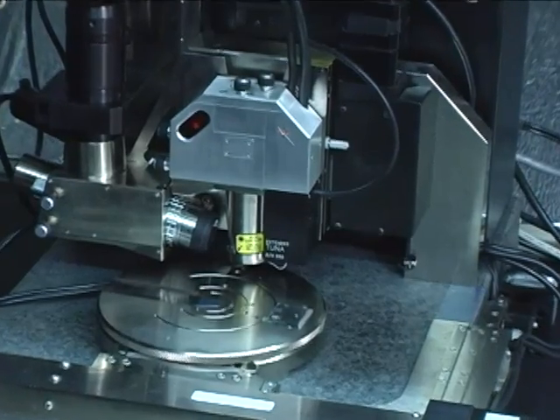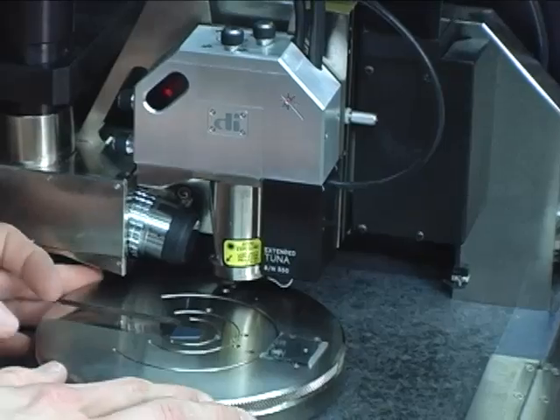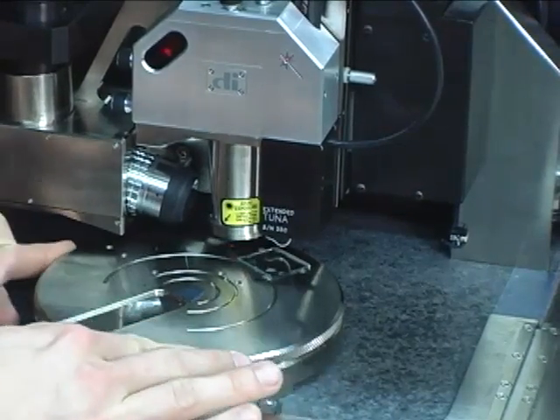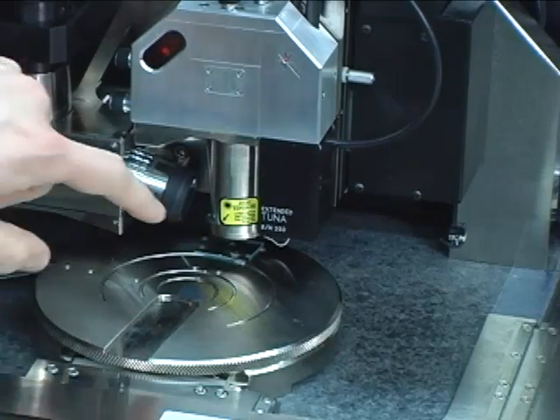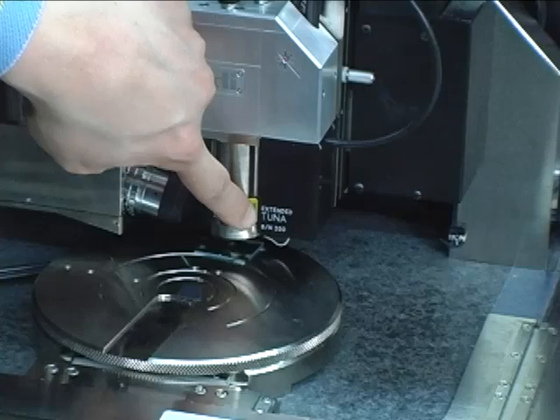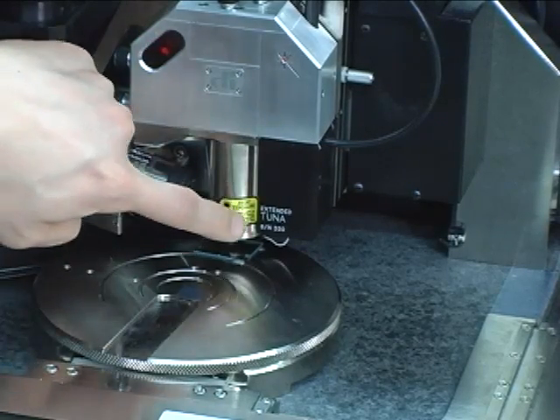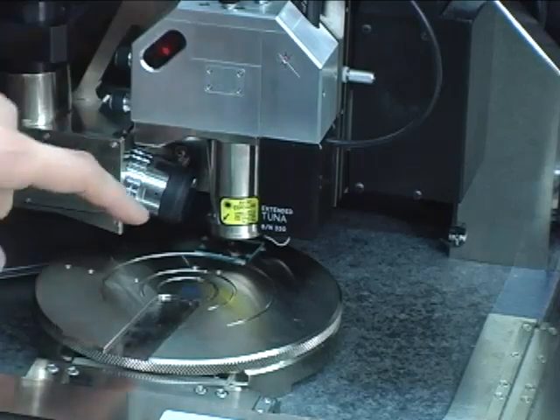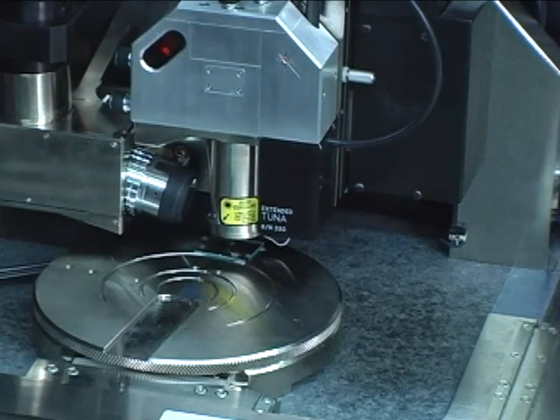We then turn the vacuum chuck on and rotate the sample beneath the AFM tip, making sure that the wire for the conducting tip connection to the amplifier does not touch the sample chuck because that will cause interference in the images.